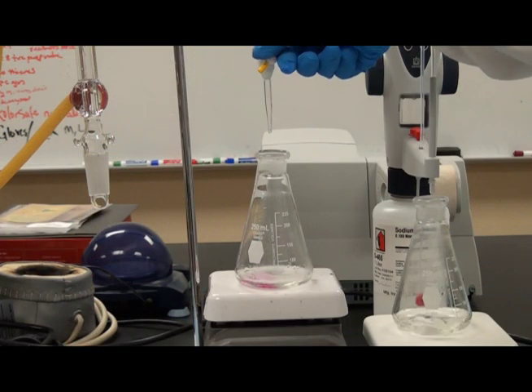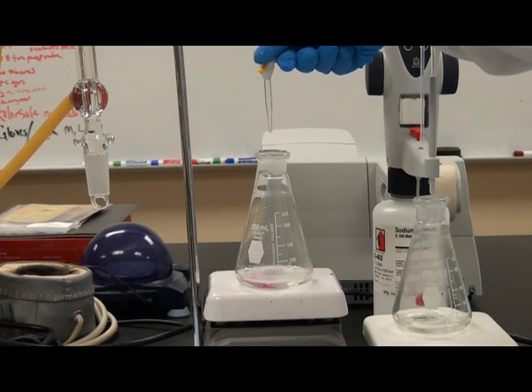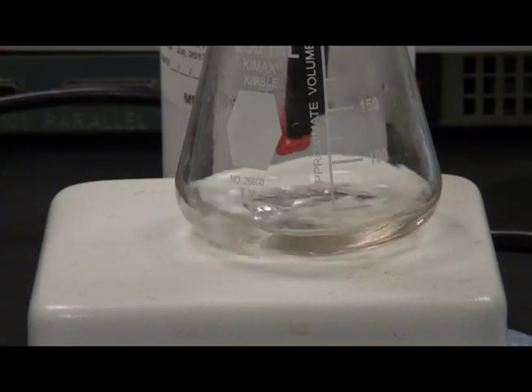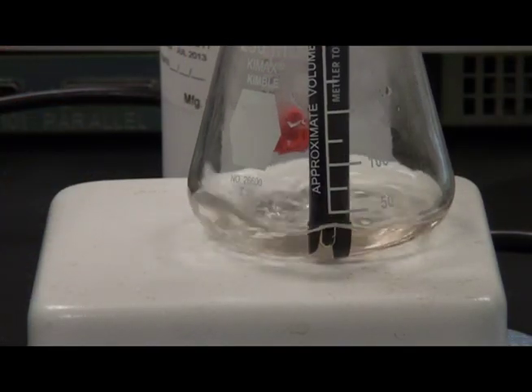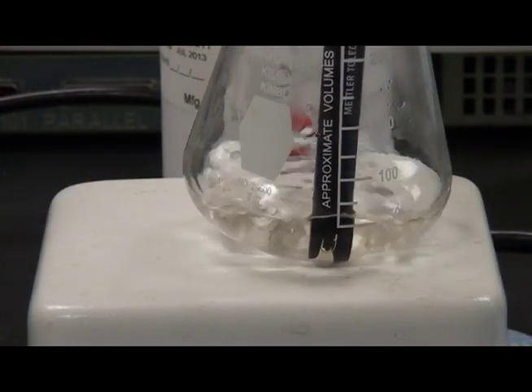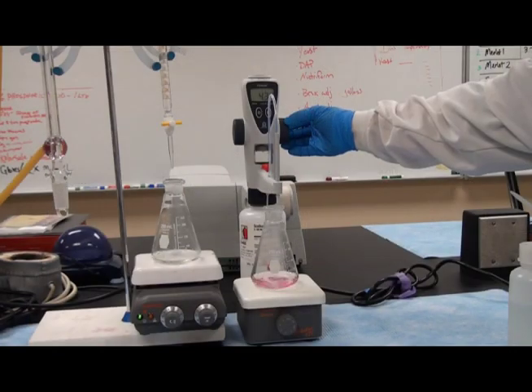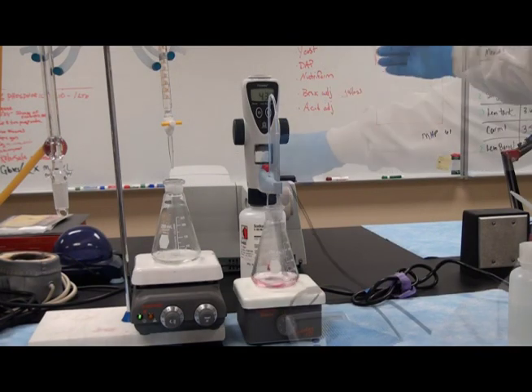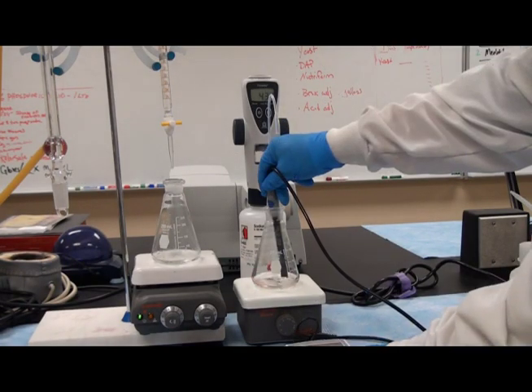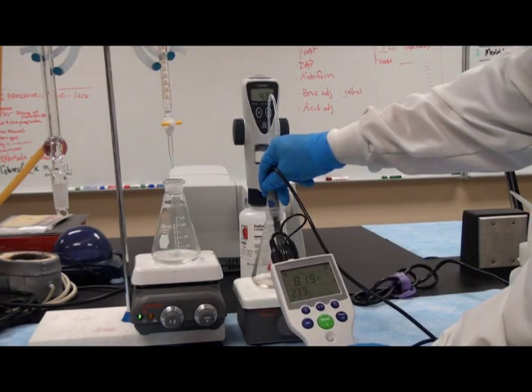Titrate the Erlenmeyer flask sample to a pink endpoint. Measure the pH of the sample as you near the endpoint of the titration. Continue the titration until an 8.2 pH endpoint is achieved.